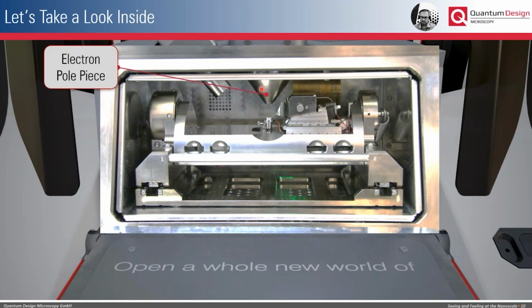First, of course, we have here the pole piece of the electron gun that enables you to perform the SEM imaging. Then we have here on the right side of the chamber the AFM scanner that can be moved in X, Y, and Z. So you can also retract the AFM head completely out of the field of view of the SEM if you only want to perform the SEM analysis.